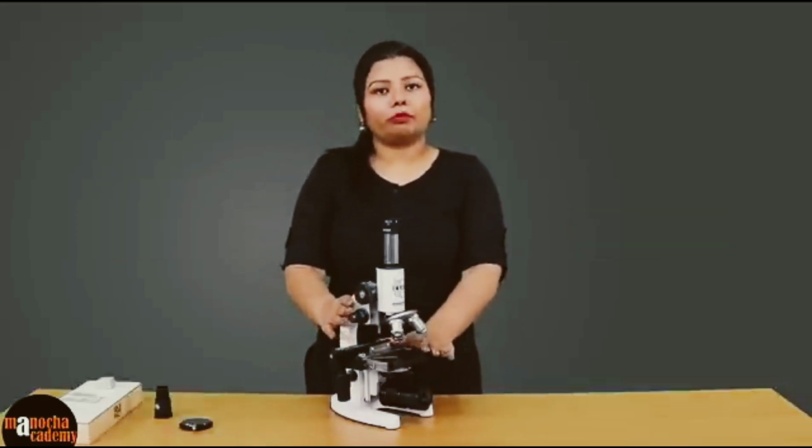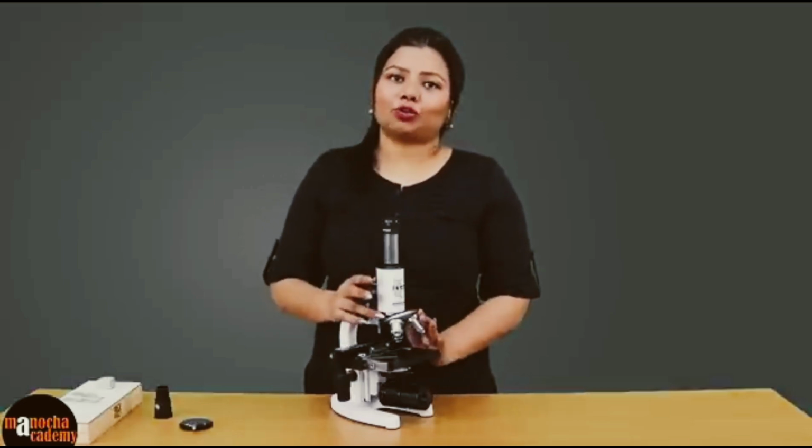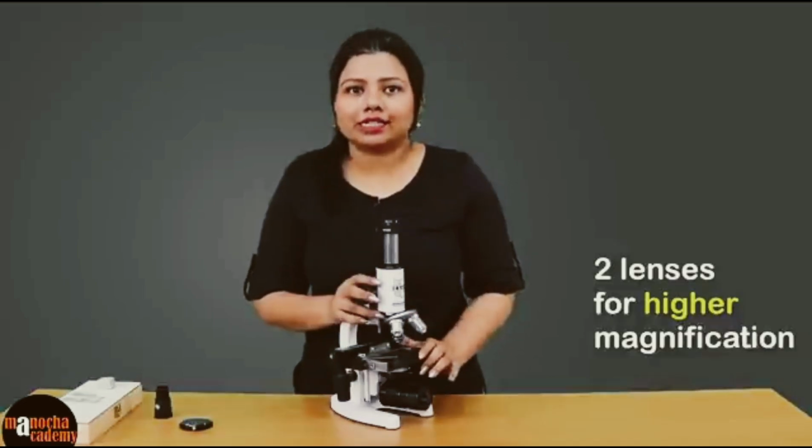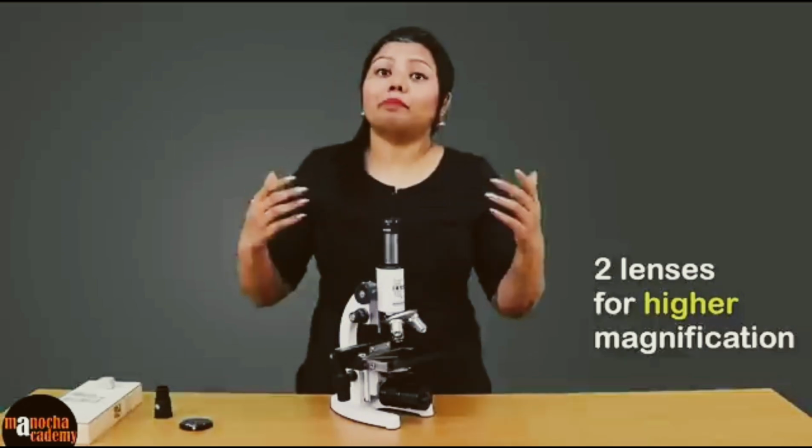Why is it called a compound microscope? It is known as a compound microscope because in this microscope we use two different lenses with different magnifications so that your final image has a much larger magnification. So let us see what are the different parts and how they help in observing specimens.